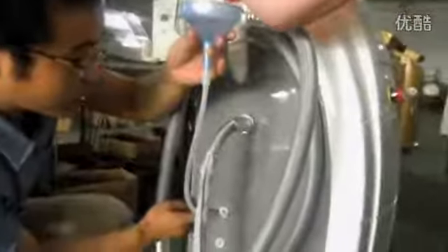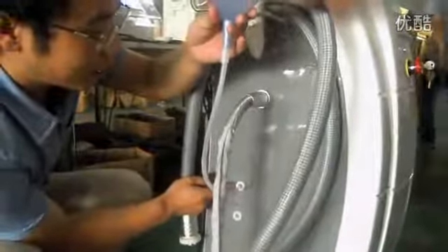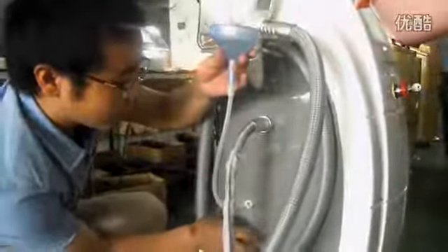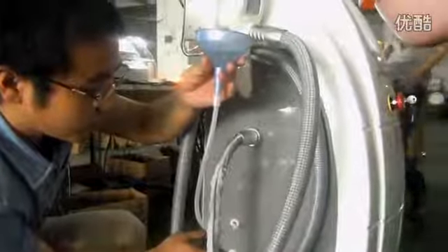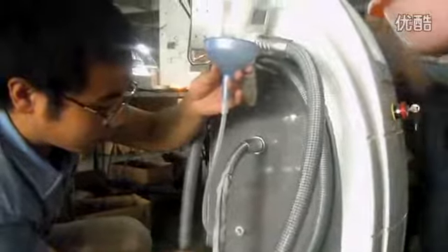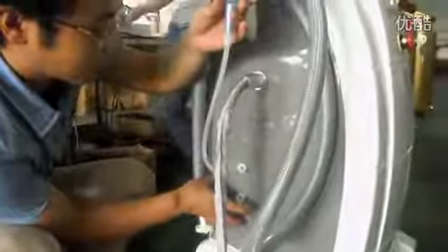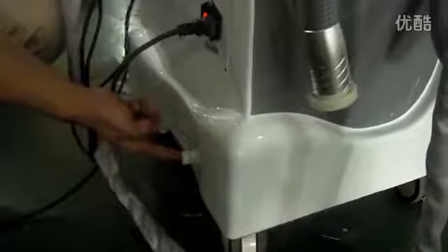Here is the water inlet. Here is the overflow. Whenever the water is full, the water will overflow — just like this — it means the water is full. Here is the water outlet. When you open it, the water will come out. Water outlet.